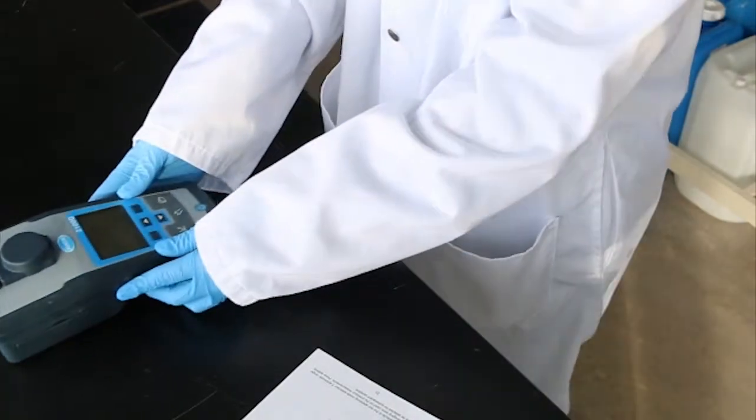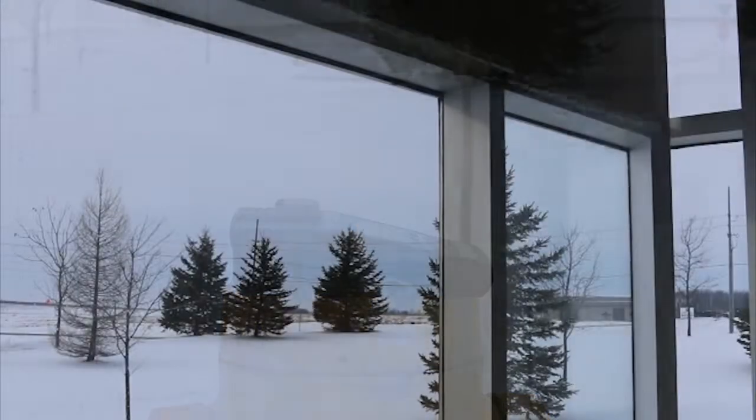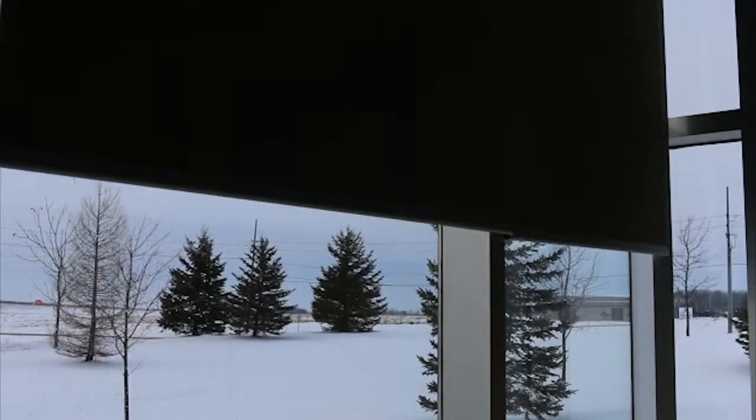To prepare for the measurement, make sure that the instrument is placed on a level surface during its use. It is best to avoid operating the instrument in direct sunlight.